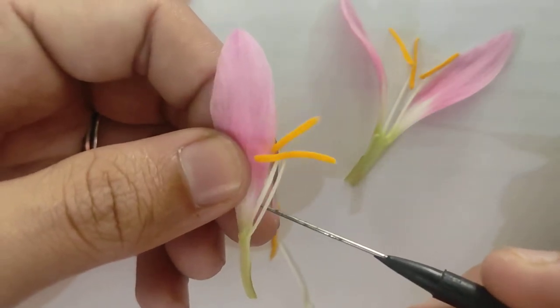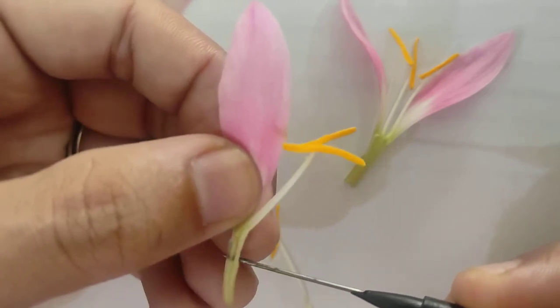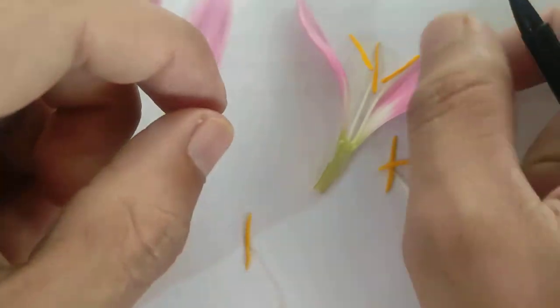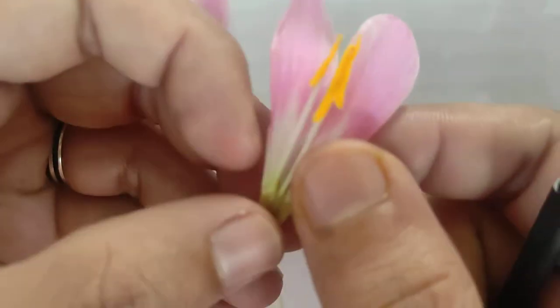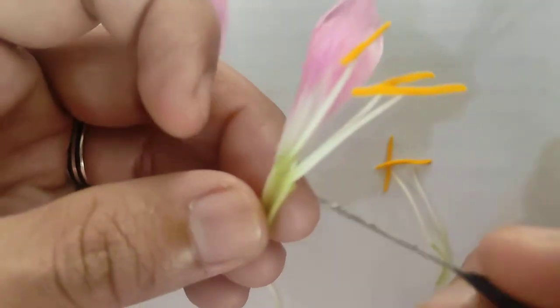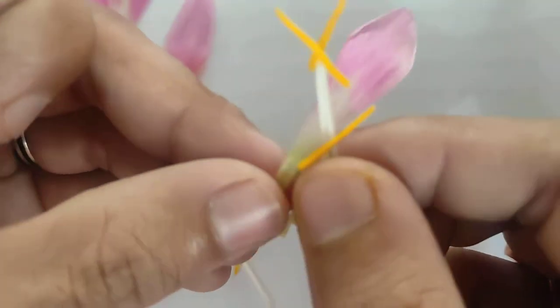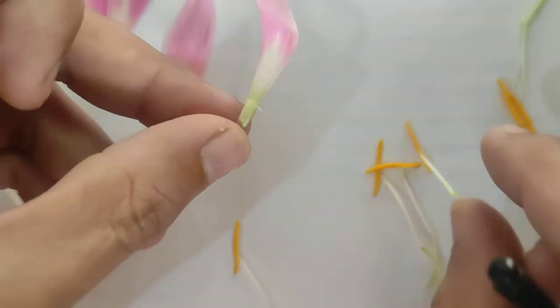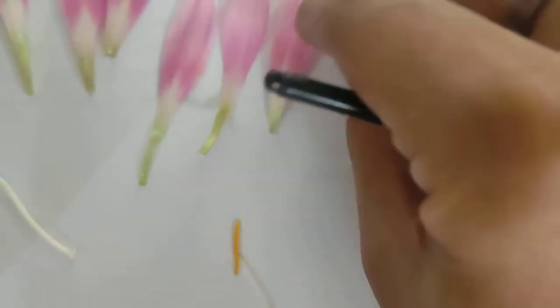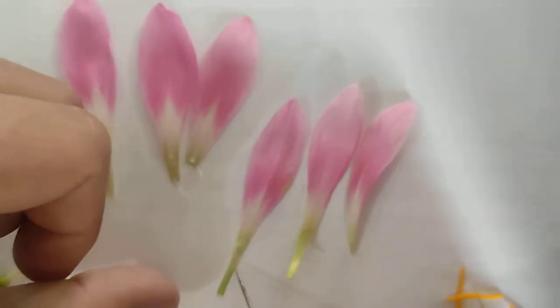We can detach these stamens from the tepals with the help of a needle. We have now separated our androecium from our tepals. These were the outer whorl and these were the inner whorl.